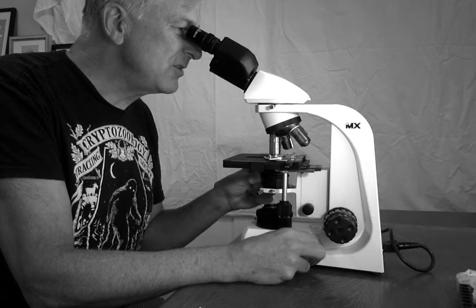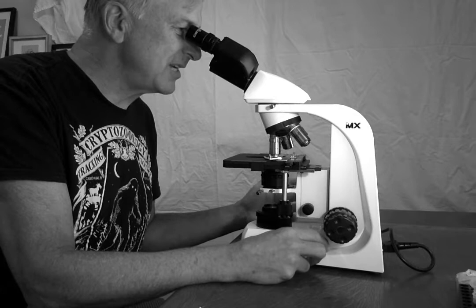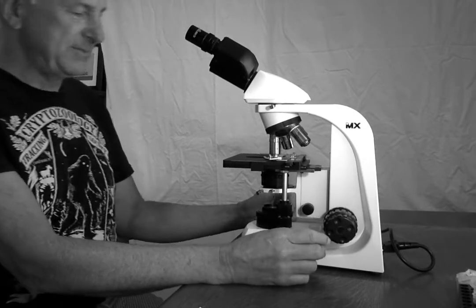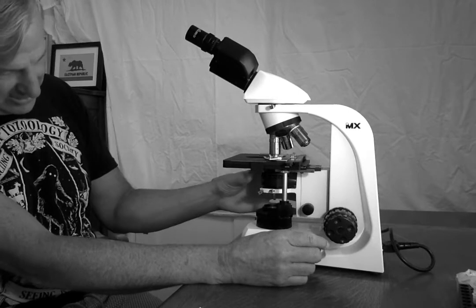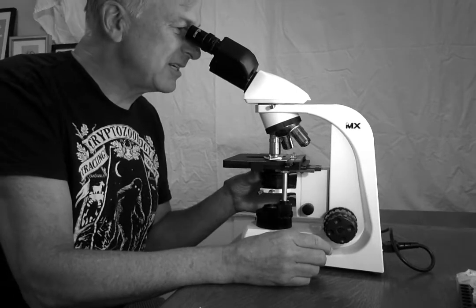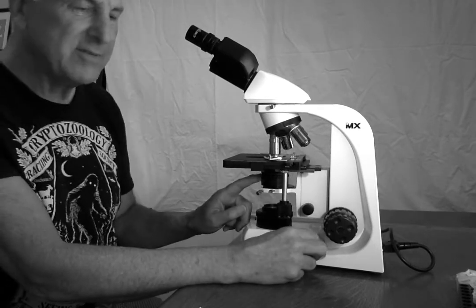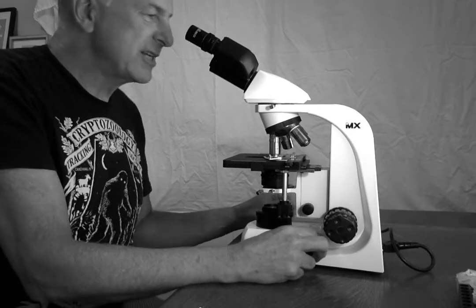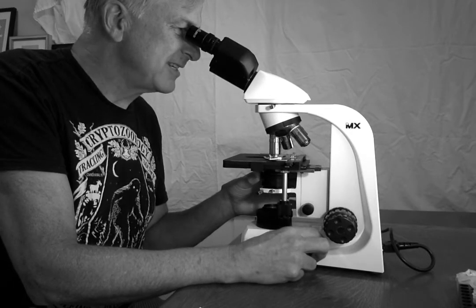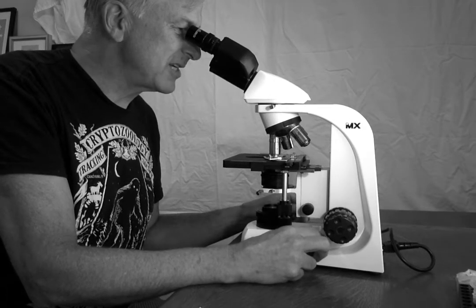If I close the iris diaphragm down on this view, it sort of totally changes what I'm seeing. I see a lot more edges. So this increases the contrast when I close it down, but it's not as well illuminated. So you kind of have to play with the rheostat and the iris diaphragm to say how much light is best. What is showing me the most? What is showing me what I want to see?